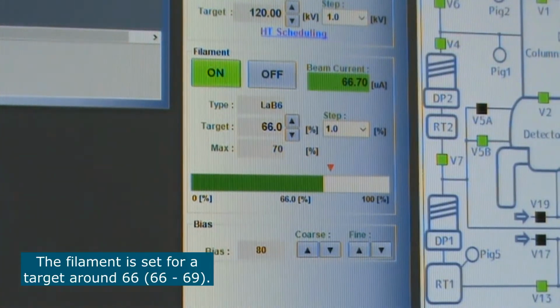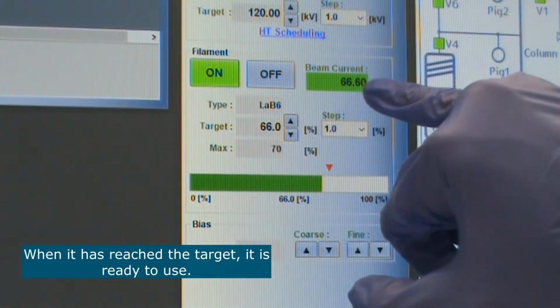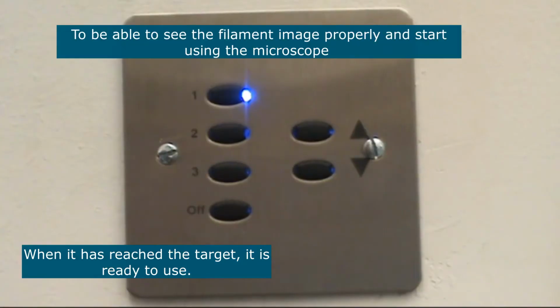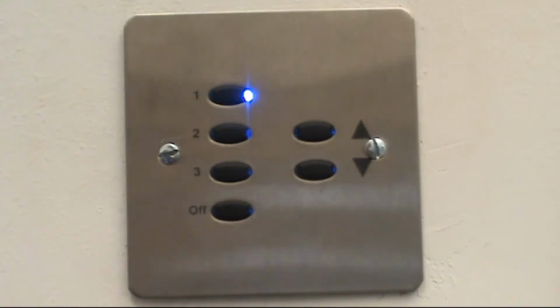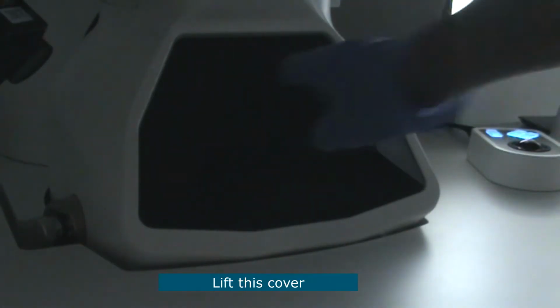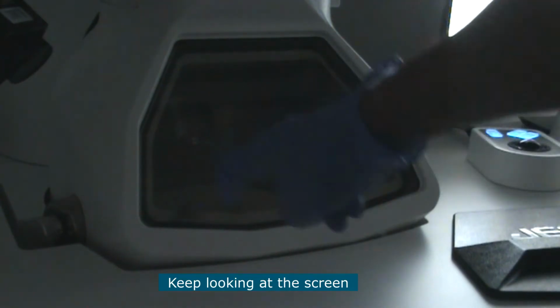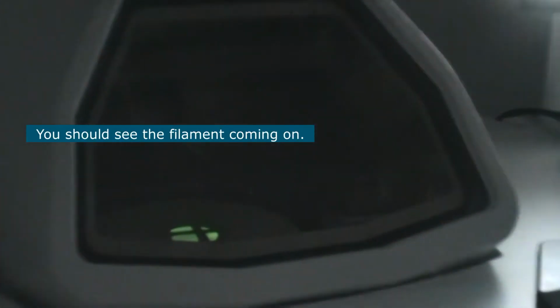The filament is set for a target of 66. So when it has reached the target here, the filament is ready to use. To be able to see the filament image properly and start using the microscope, switch the room lights off, lift this cover, and keep looking in this screen here, and you should start to see as the filament comes on.